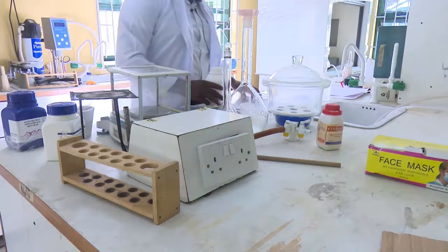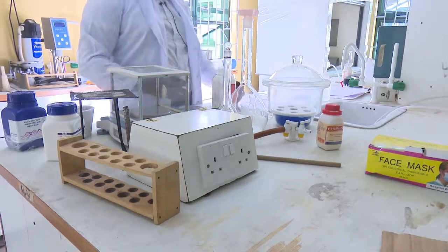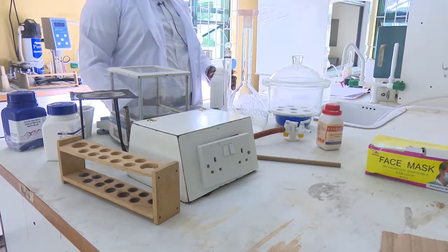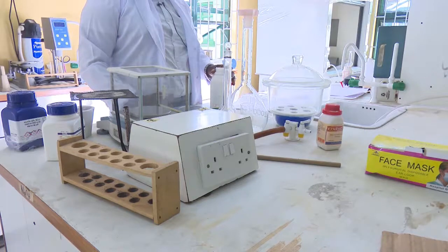Thank you, students. Just as we heard from our instructor, we were told how standard solutions are to be prepared in the lab.